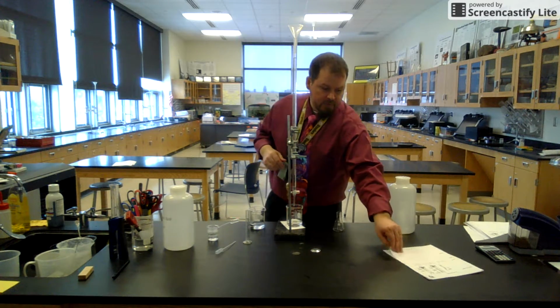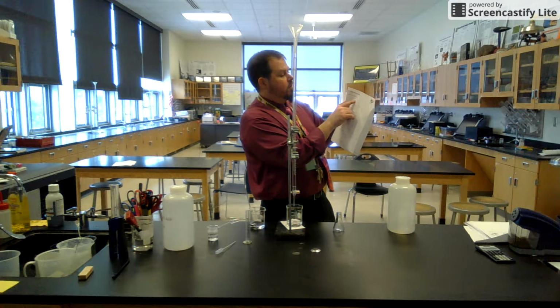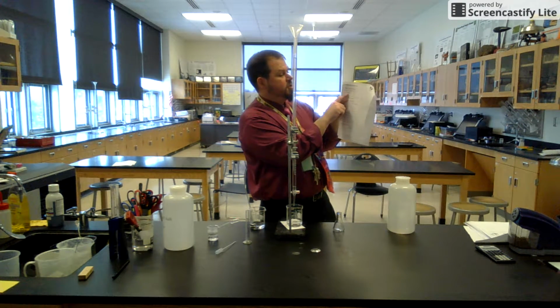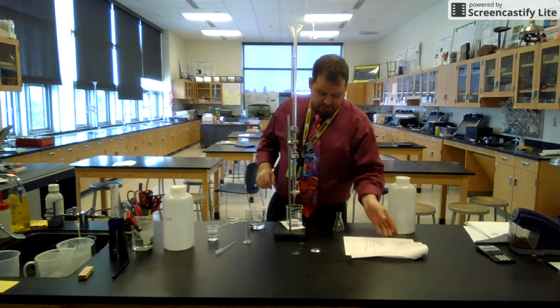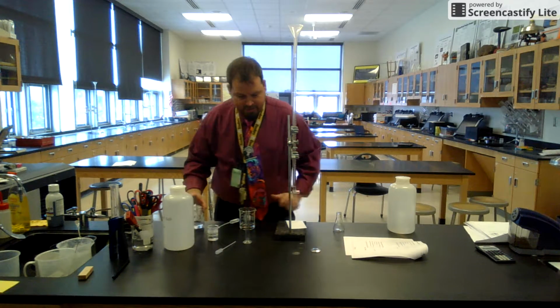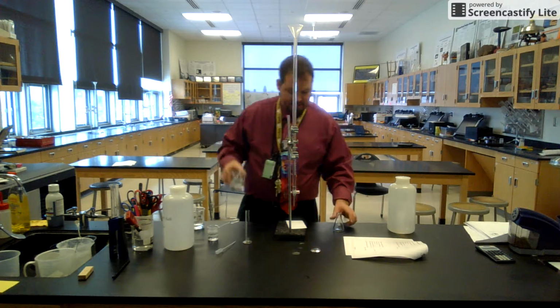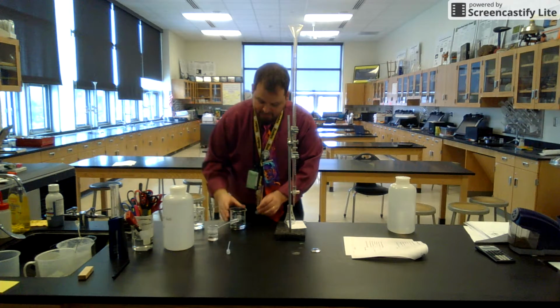So when it says volume of unknown acid, we're going to do that in a second. Initial burette reading, I just set it to 0. So my initial burette reading is 0. Okay, so I'm good with the base. Now I need 10 mils of acid per titration. 10 mils. You need to know the volume of acid.